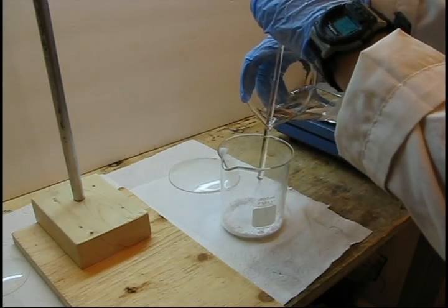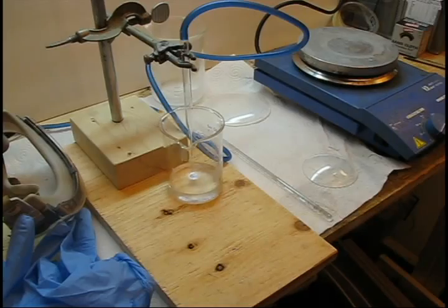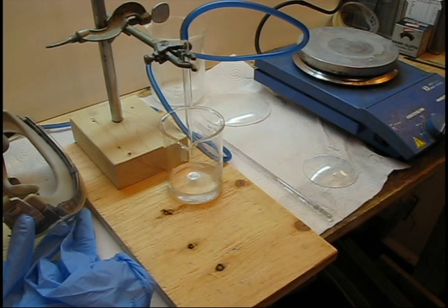Slowly add the hot isopropanol to the beaker until fully dissolved. Stirring is necessary. Once your acetylsalicylic acid is fully dissolved, you can remove the isopropanol by using a disposable glass pipette to blow a stream of air at the solution of evaporating the isopropanol. I have found that this method gives a better yield because simply trying to boil off the water or isopropanol will hydrolyze the acetylsalicylic acid to salicylic acid, while room temperature evaporation avoids this.